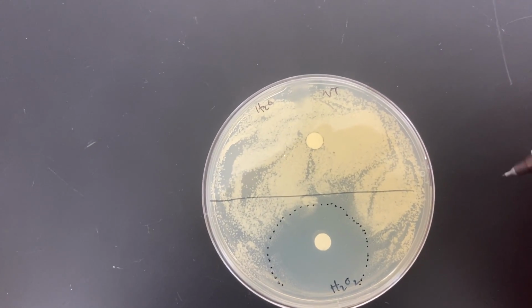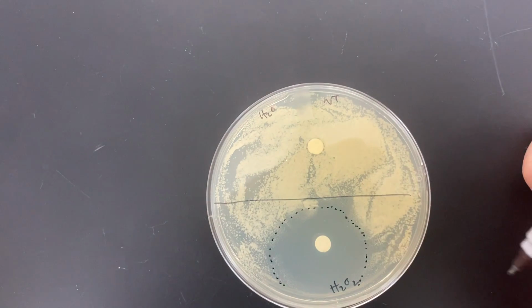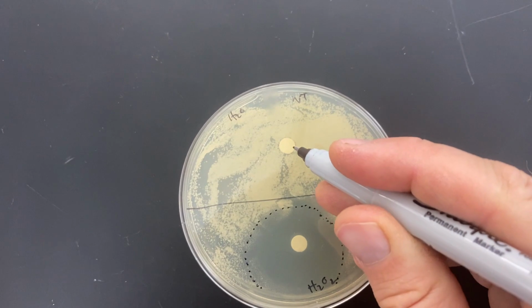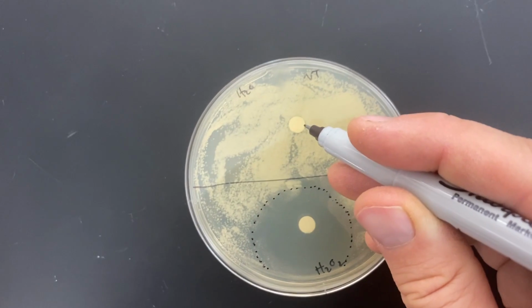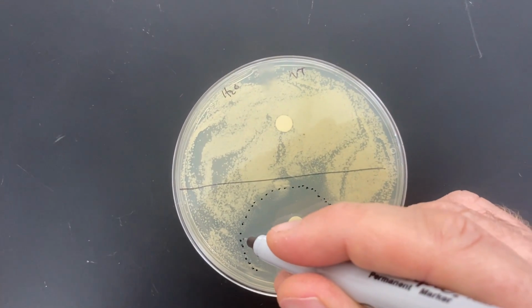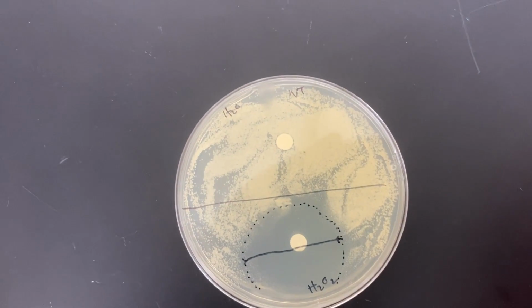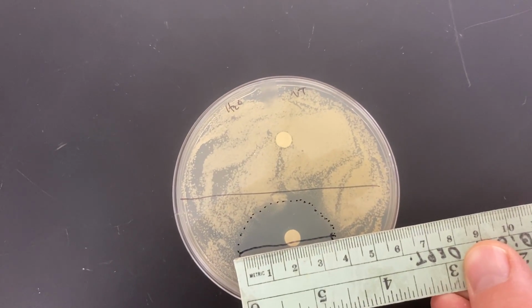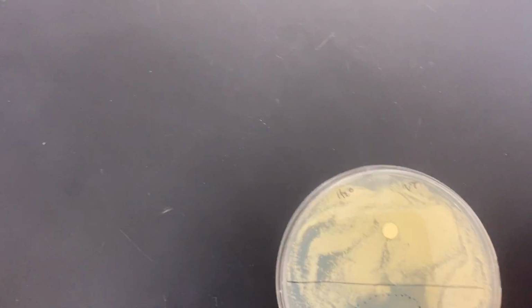So this is the zone of inhibition, or basically the distance from the circle, the dot of paper, where cells really weren't able to grow during this time. They were able to grow right up to the circle in the water. That's no surprise. Water shouldn't be a problem for yeast cells to grow next to. But hydrogen peroxide is an oxidative stressor, and so they would have a distance that they can't really grow across. For this one, we're going to measure the diameter. So I'll put my ruler down on there, and I'll give that 3.7 centimeter diameter.